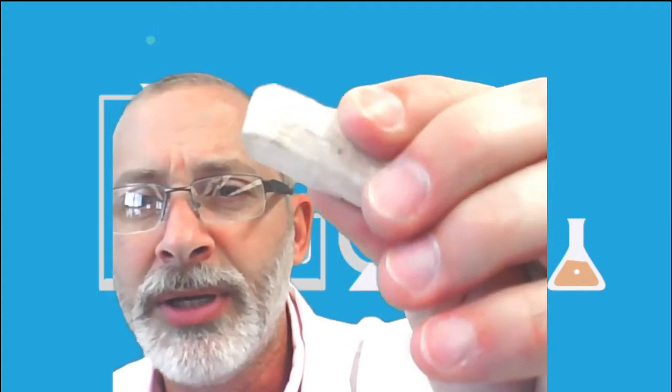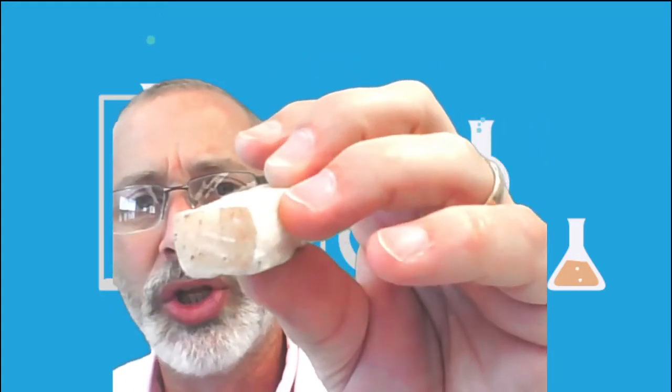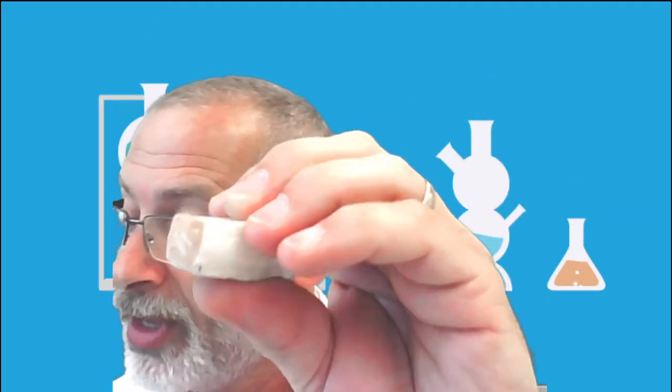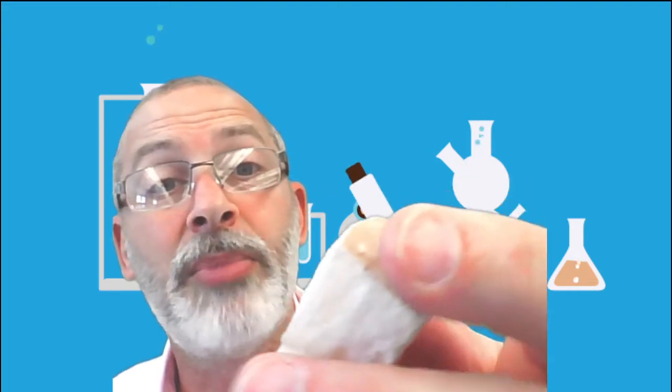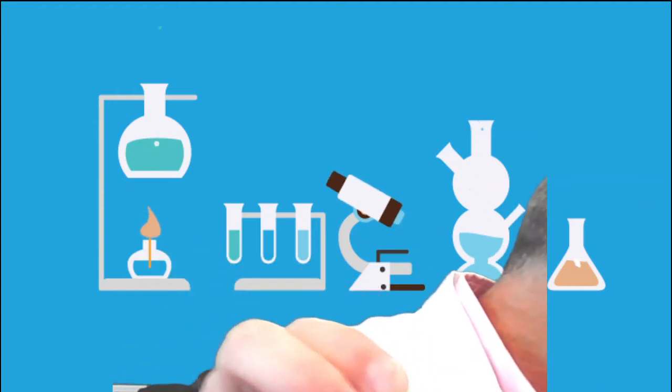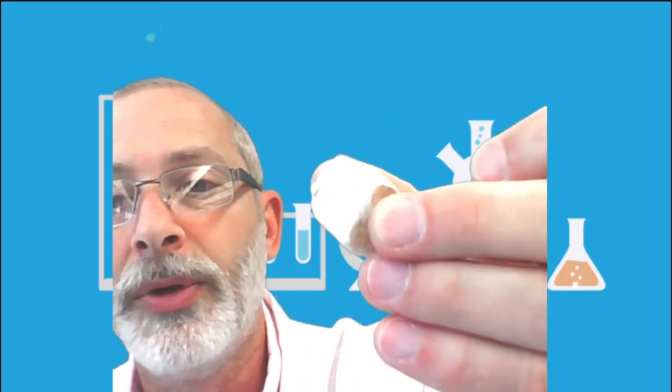Here it is. Mineral number 10, it's very fibrous in nature. It's like these long columnar crystal structures here. And that's the hint, by the way. It's almost fibrous, its crystal structure. Here's another one. Let me show you this one. Maybe this one will show up a little bit better, or maybe not. Okay. And it's also very soft, soft enough you can really scratch it with your fingernail.